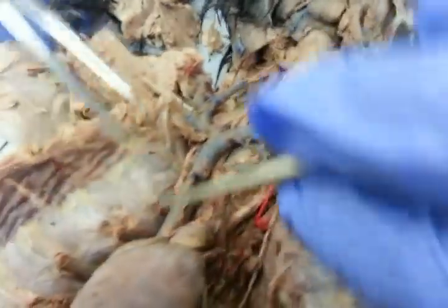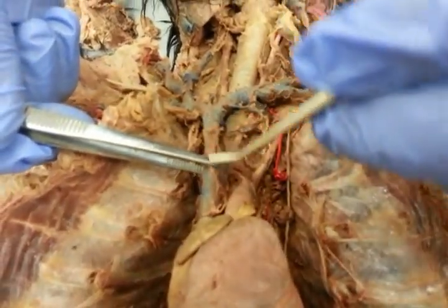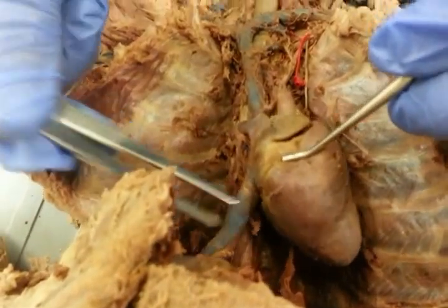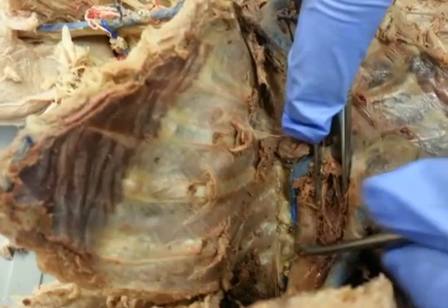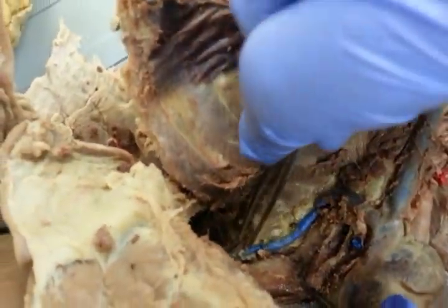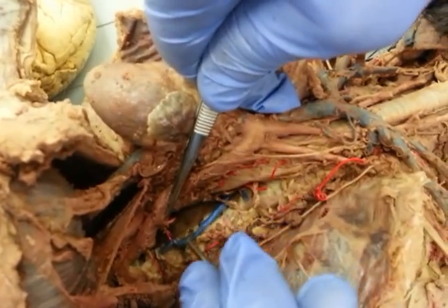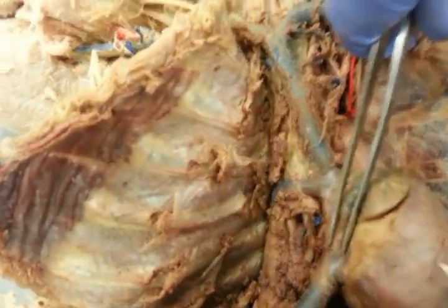All right, so these are going to go over the veins of the heart. So this right here is going to be the cranial vena cava, the caudal vena cava, and the first branch, if we turn this over here, is going to be the azygos. And the azygos is going to curve off the cranial vena cava and run all the way down, which you can still see if we shove everything over to the right-hand side. This is still azygos right there, coming off the cranial vena cava following the sympathetic trunk.